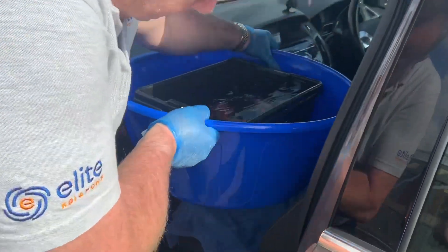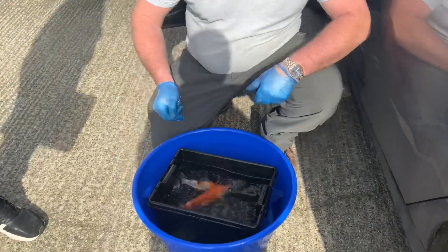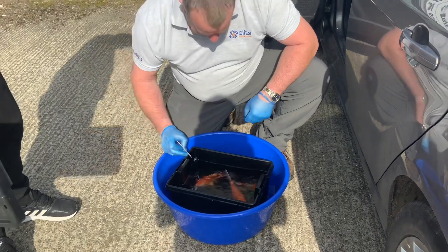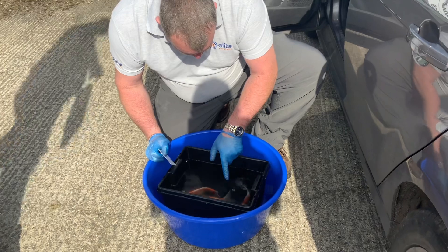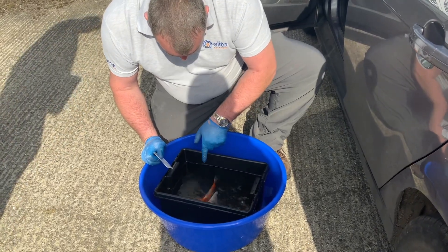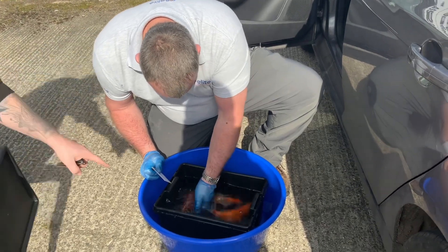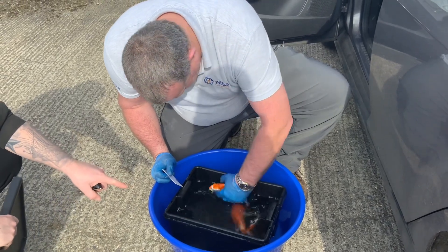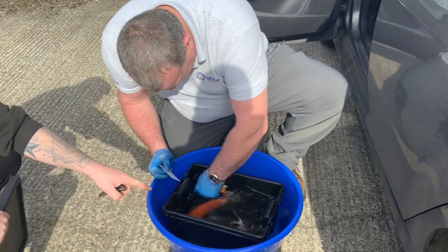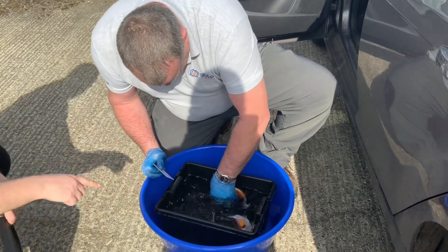It's a good way of transporting them — there's a lid there for moving them around. On first inspection of the koi, just looking to see how they're acting, they look healthy. What have they been doing? That one's been clamping up on its right-hand side — only one pec fin. And that one's been clamping up on its left-hand side. And the third one has been flashing a lot.